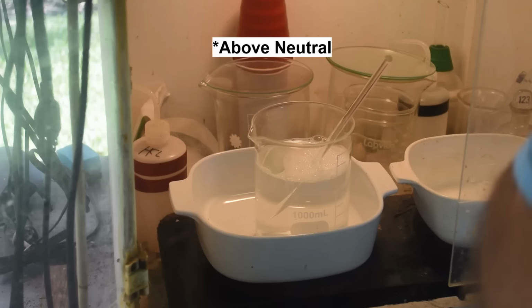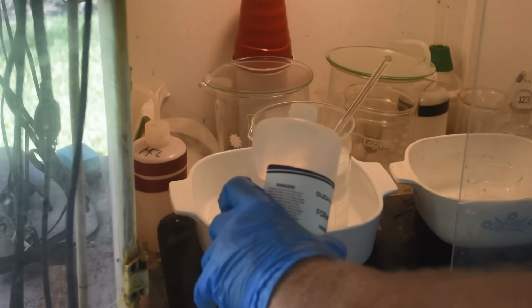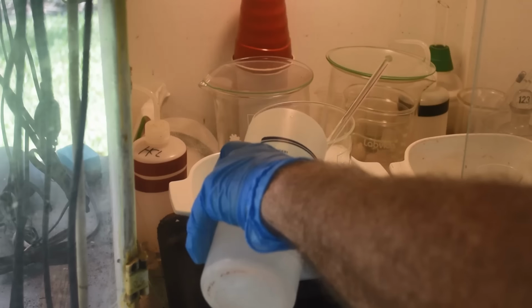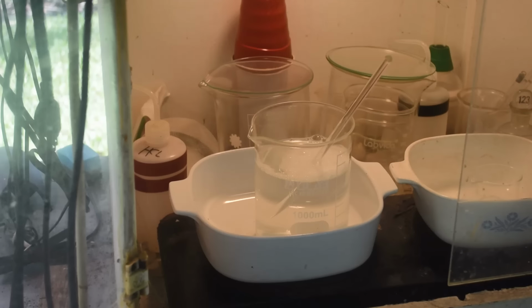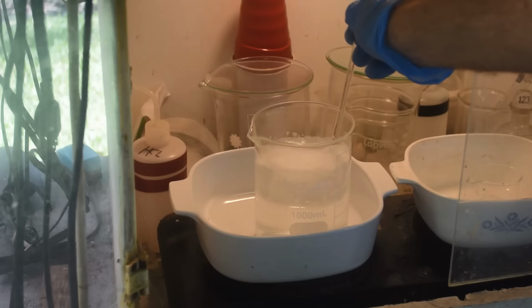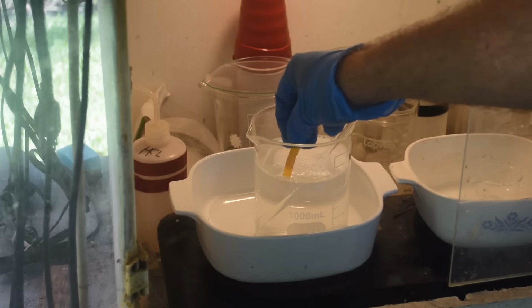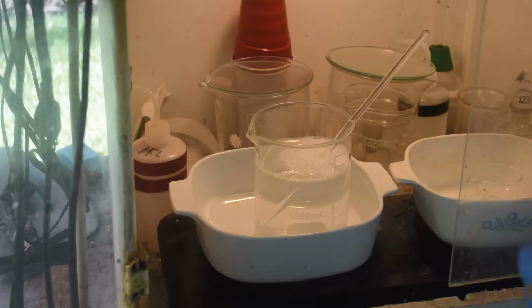That's gone green. Okay. So now we're just going to put a little bit more formic acid in there and bring it back to acidic. And it should not take much at all based on this experience. Get it good and stirred up here. Okay, I would say we are slightly acidic, so I guess we're good. I think we are ready to move on to the next step.